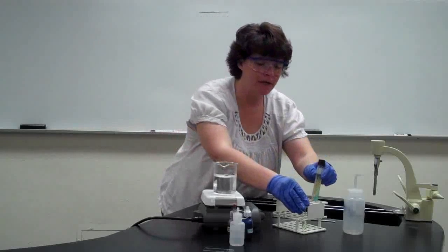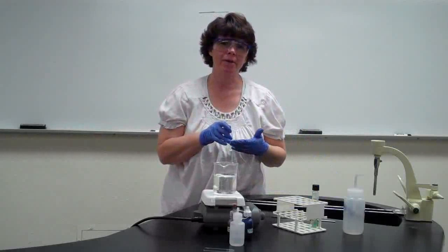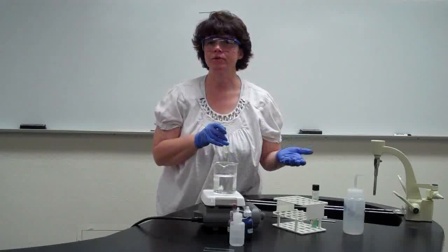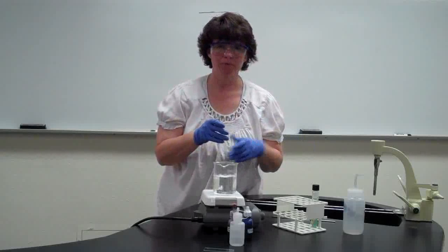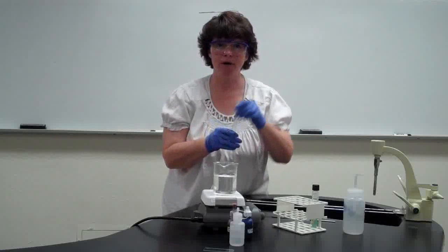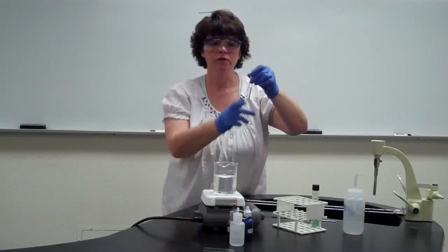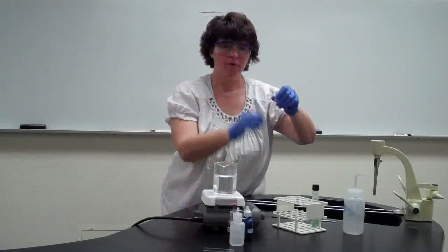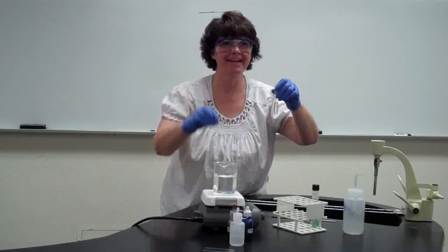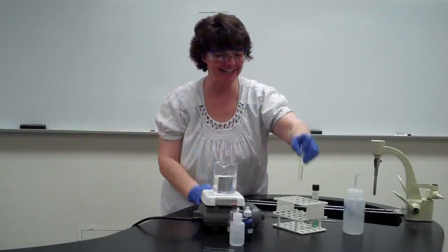Now, depending on how they grow, Mycobacterium is different from a lot of bacteria in the fact that it grows really slow. Some of them can take several weeks to grow. This one we were hoping will grow up in about 4 days. So if they grow up properly, they're going to be in a normal broth tube like we're used to seeing. So you would just do your flicking, pull the bacteria out using your aseptic technique, and put it on your slide.